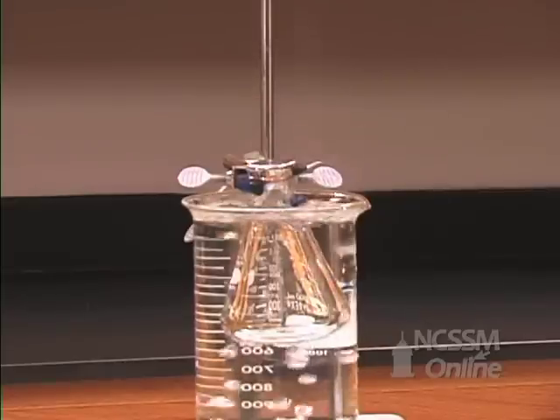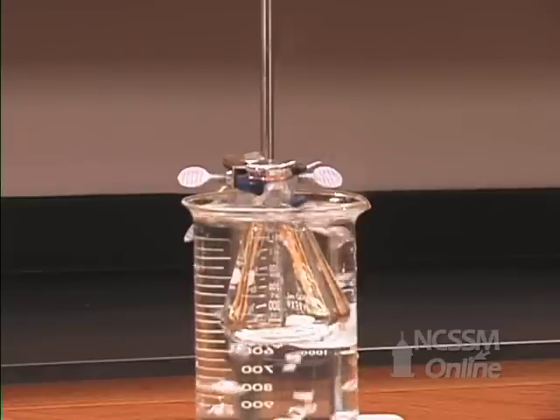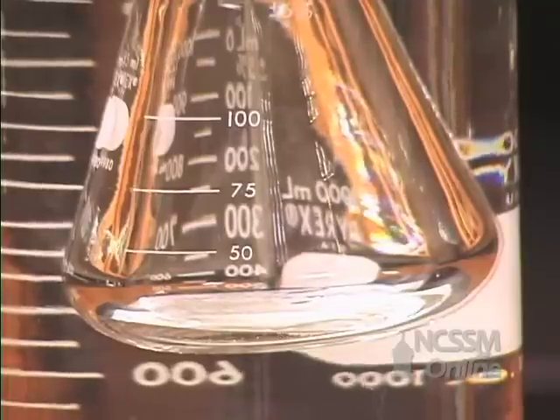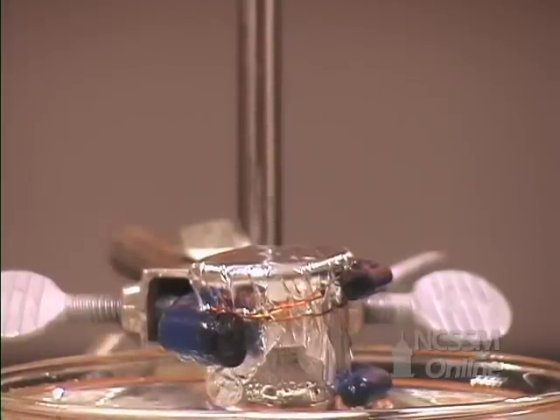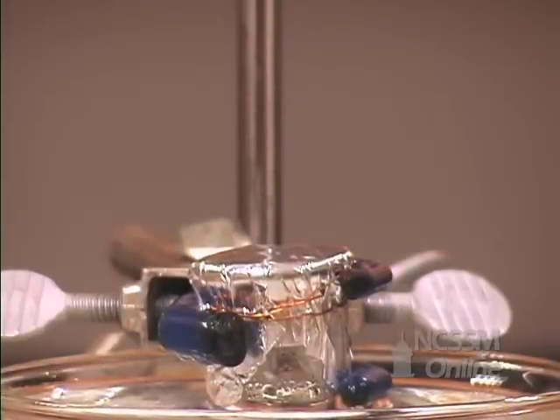We immerse the flask in a beaker of boiling water. The liquid inside the Erlenmeyer starts to boil and vaporizes. As it vaporizes, it pushes air out of the pinhole.